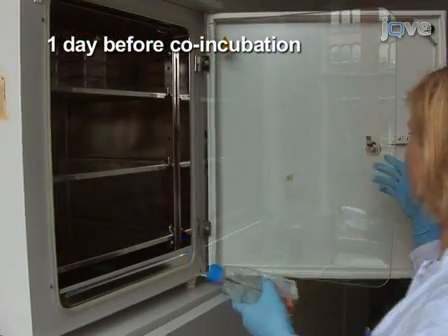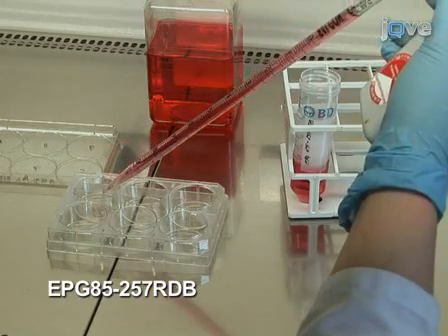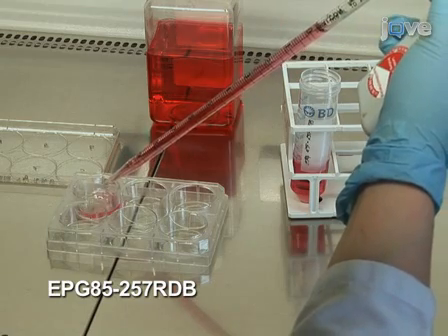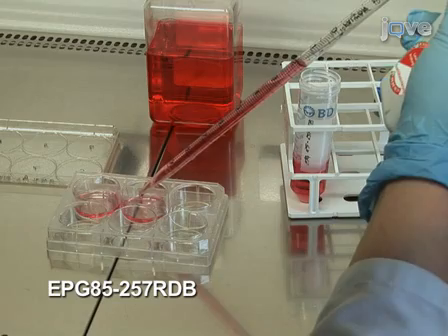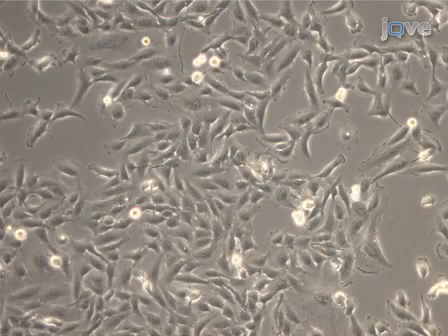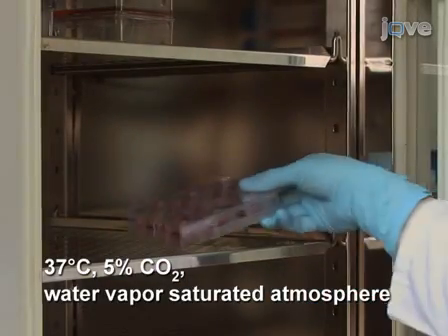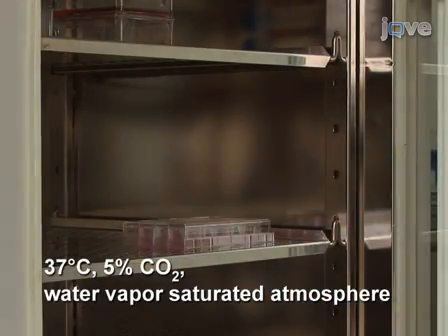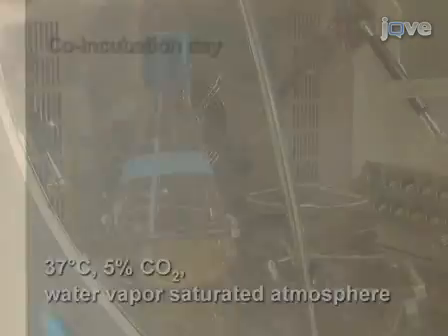On the day before incubating the bacteria with the target cells, seed 25 × 10 to the 4 human gastric carcinoma cells per well in 6 well dishes. The number of seeded cells depends on the speed of cell growth of the cell line. Plan the seeding time so that the confluency is about 70 to 80% 24 hours after seeding. Incubate the seeded cells at 37 degrees Celsius in a 5% carbon dioxide water vapor saturated atmosphere overnight.